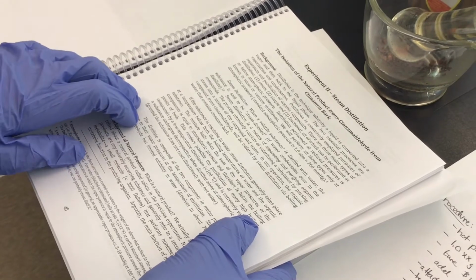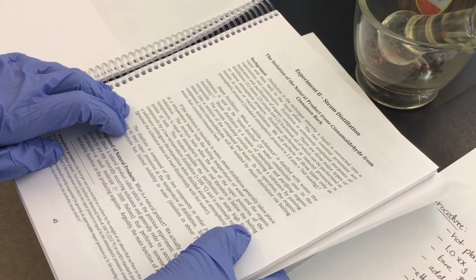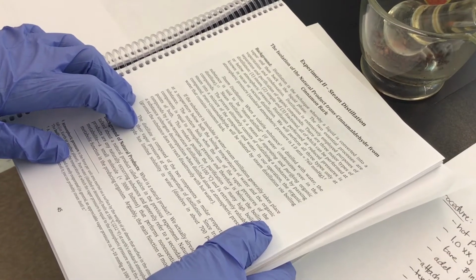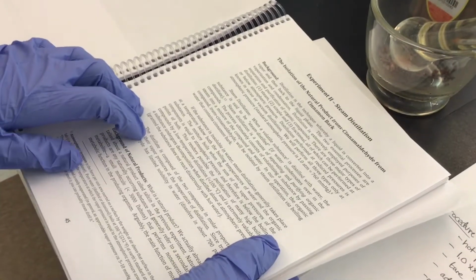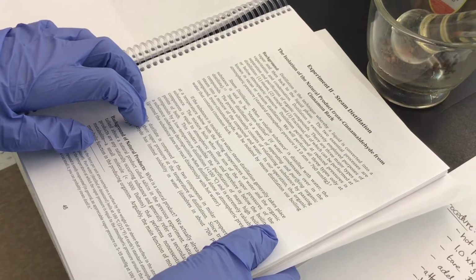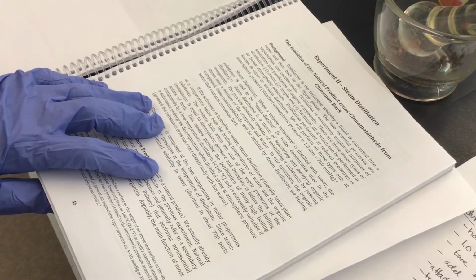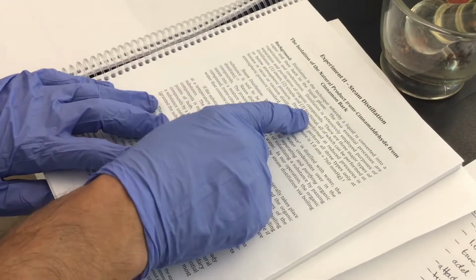The pre-lab lecture video explains in greater detail, but let's remind ourselves that distillation is the technique whereby a liquid is converted into a vapor and then back condensing to its liquid phase. So this is vaporization and condensation. Distillation is very prevalent as a practical technique for organic chemists. And we divide them into 3 major types: steam distillation, simple, and fractional distillation.